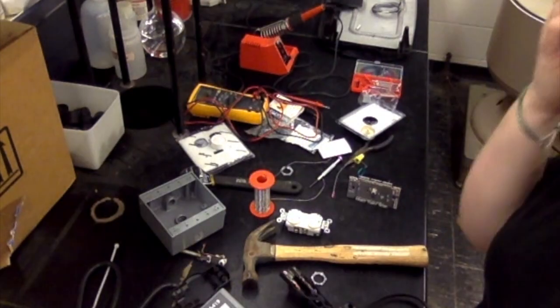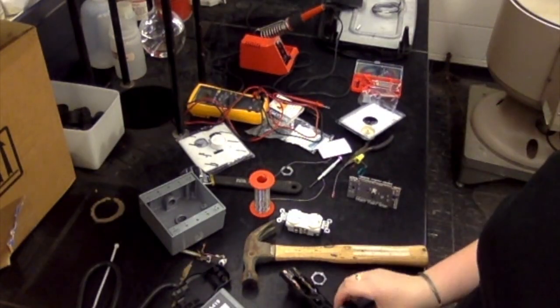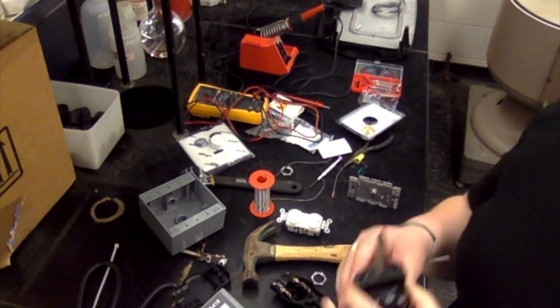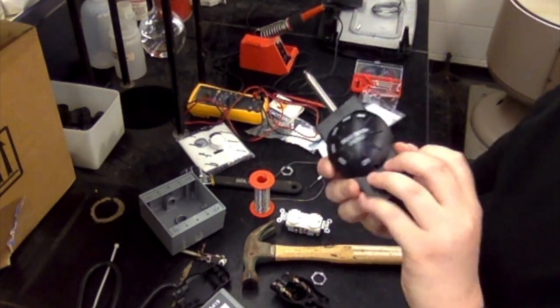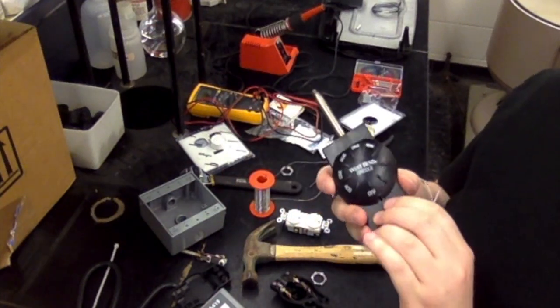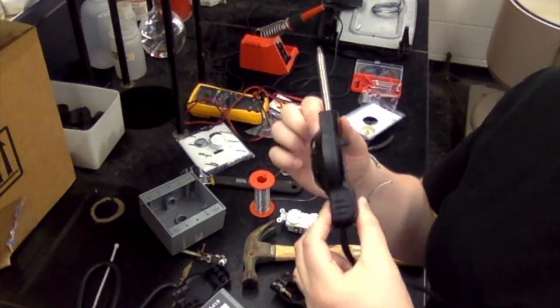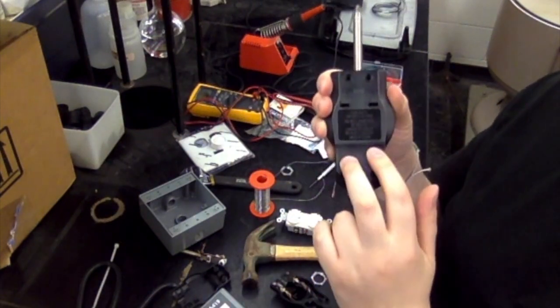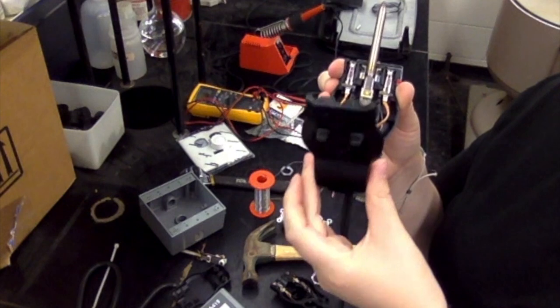The first thing that we're going to do to make these modifications is to reconfigure the stock controller. So this piece here is the stock controller. It's usually just plugged into the griddle. You're going to pull it out, and we need to open it up. To open it up, there are 4 screws on the back. You're just going to take those 4 screws out, and this back piece is going to pop off.